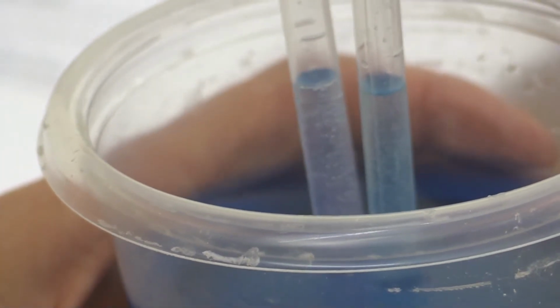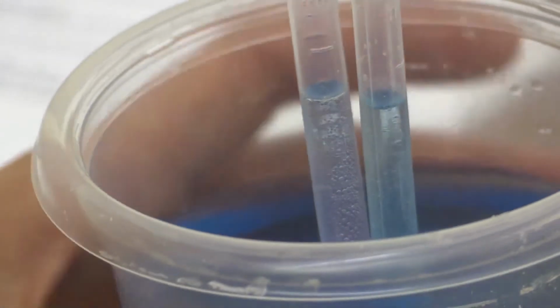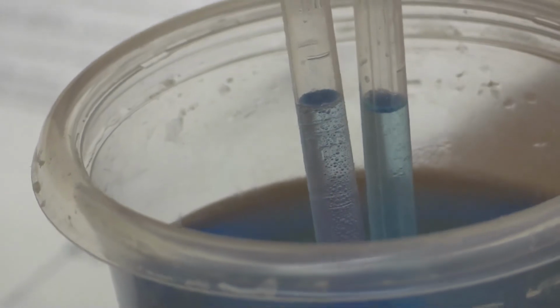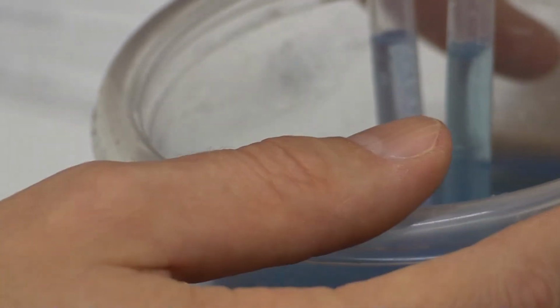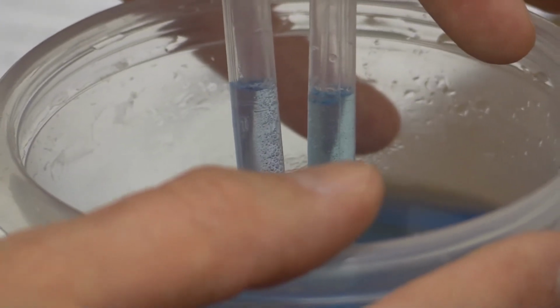And then we just had them dispose of the solution afterwards down the drain. And if you do a close-up of this now, you should be able to see, oh my goodness, that one of the pipettes is green and the other one is pink. And so we've been able to successfully monitor the reaction.